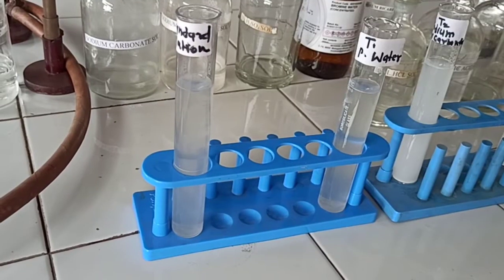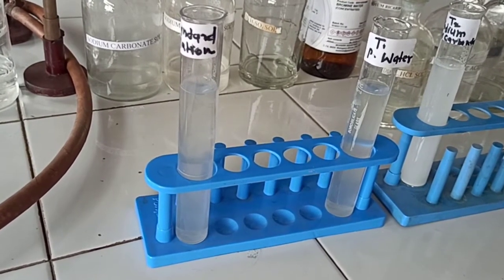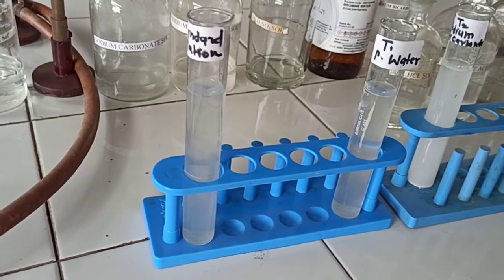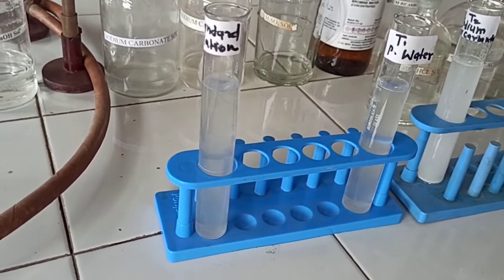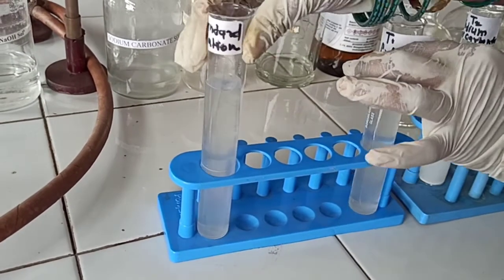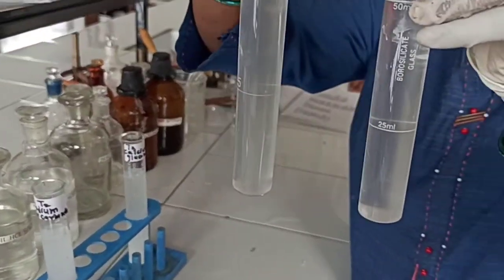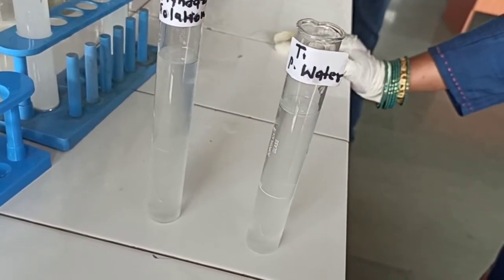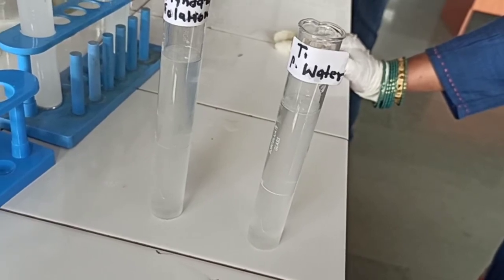Observing the standard solution alongside test solution T1 of purified water, after 1 hour there is no change in the appearance of the test solution of purified water. Therefore, the given sample of purified water complies with the limit test for sulfate as per IP.